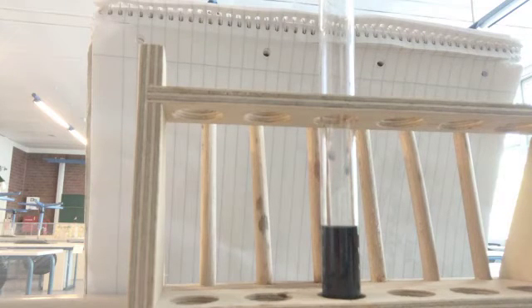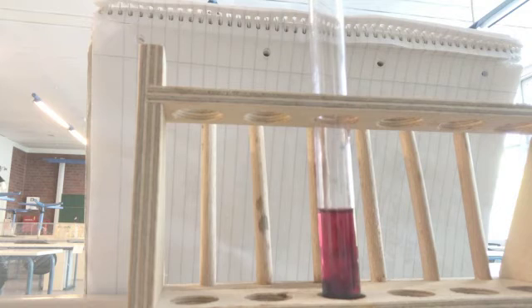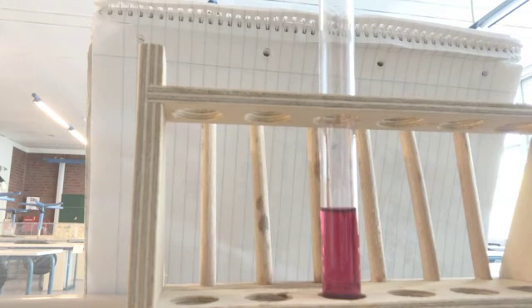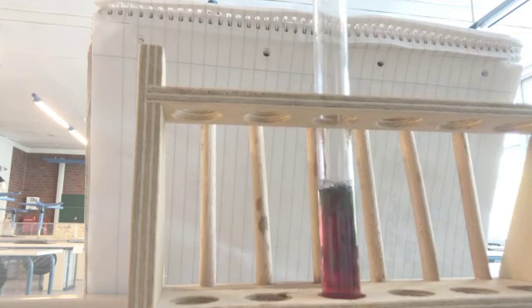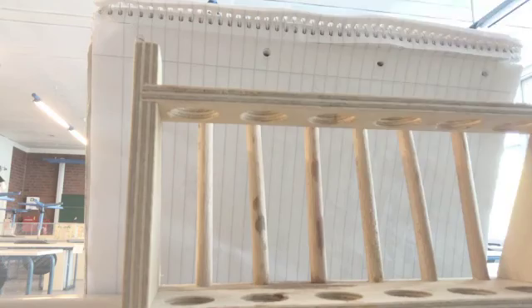And then I can also flip it back to an acid. I'm going to add acid again. As I add acid, you'll see it turn back to pink. One more time, I can turn it back to blue by adding some more potassium hydroxide. You can see it kind of wanting to turn blue, and it turned blue.